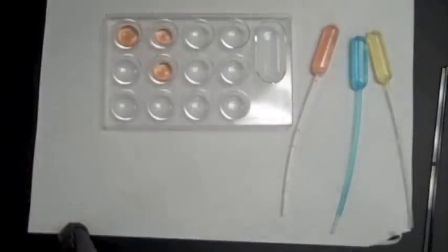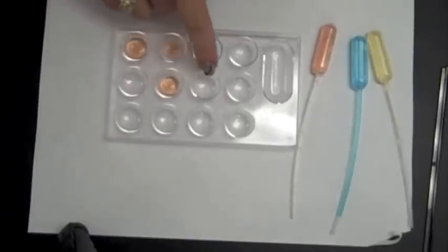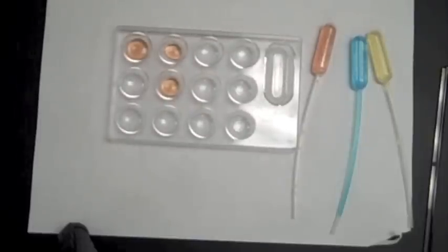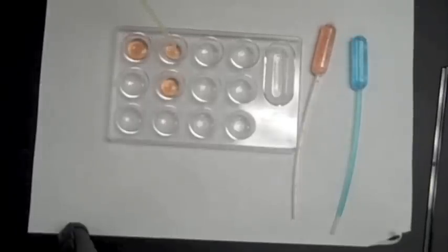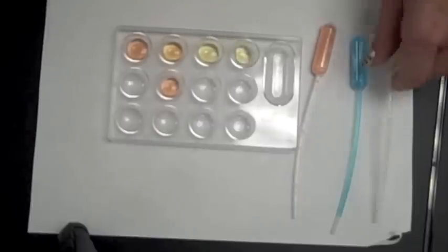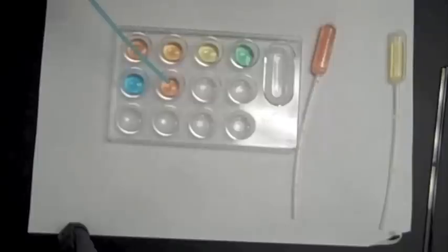Here's hopefully maybe a little bit better of a shot of the 12-well plate. Kind of hard to see the numbers, I know. This is 1, 2, 3, 4, 5, 6, 7, 8, 9, 10, 11, 12. We're only going to be using through six, though. Now we've got our red drops in. Now, we're going to add our yellow drops. It says, put five drops in the second well, 10 drops in well three, and six drops in four. Then for the blue, it tells us four drops in number four, 10 drops in number five, and three drops in six.